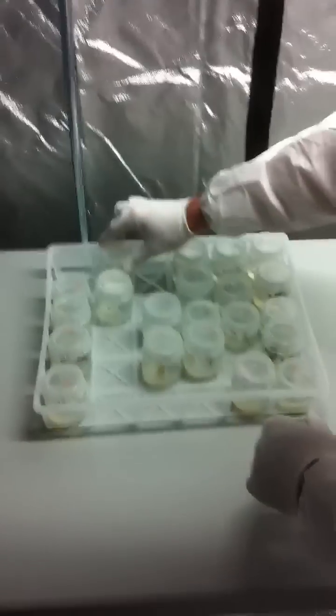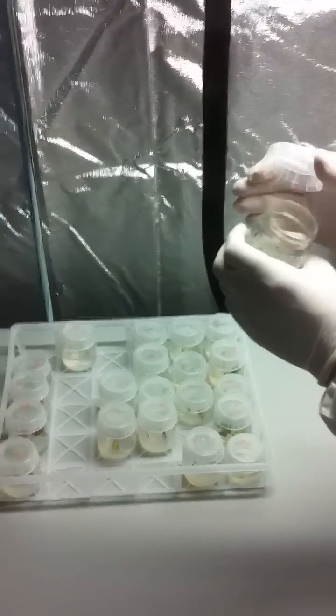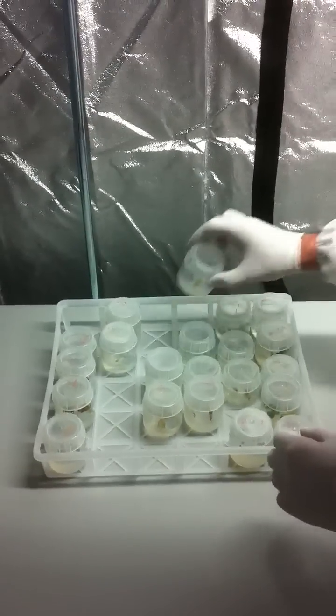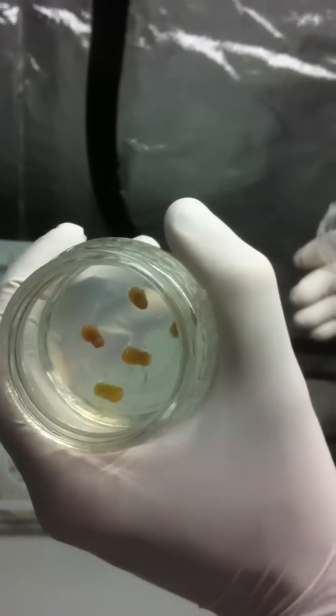So is that gel pretty liquefied then before you put it in there, or was it still pretty hard, solid? Yeah, like it is. Water. Oh, was it? Then you put it in the autoclave and it kind of cooks and hardens. Gels up then. Yeah, those are kind of blistering almost, looks like.